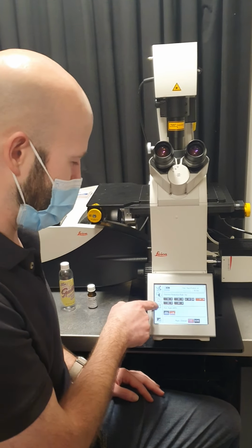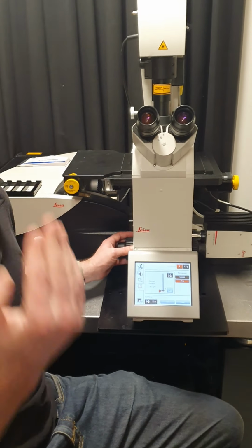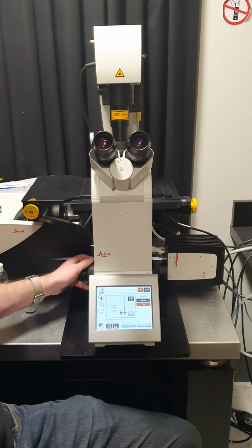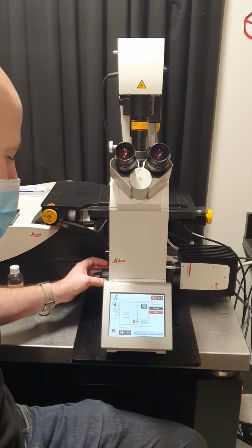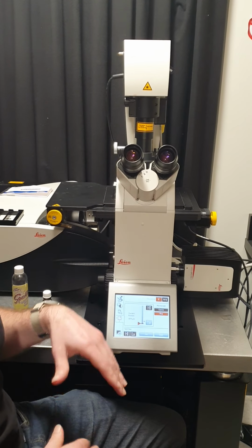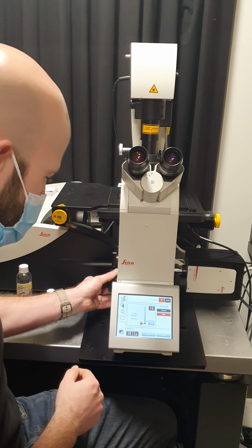And then the last tab here is just showing you where you are in the Z travel range. So you can see we're all the way down at the bottom here. And as we adjust the focus, the objectives are coming up closer to the sample. This can be helpful when you're first finding focus. Just make sure you're at the bottom, and then usually I just work my way up from the bottom until I eventually reach focus.